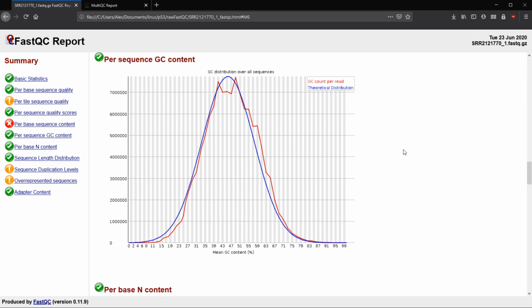But this tells us the GC content per read. So we have our cumulative reads here, and across the bottom is that percentage. We expect a fairly normal distribution if the library is truly random. So very few only have 1 or 2 Gs, and also very few have all 51 be Gs or Cs. So very few sequences have either none or all GC content. We're going to expect somewhere right around the middle, and that's where we get this peak.